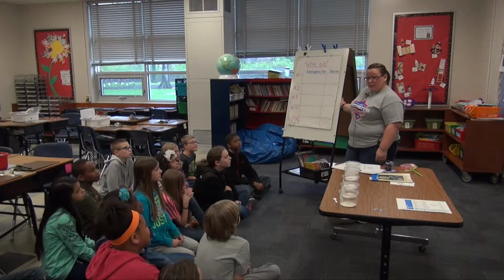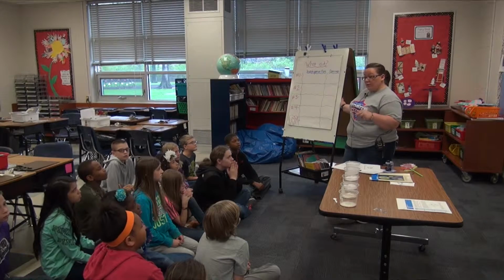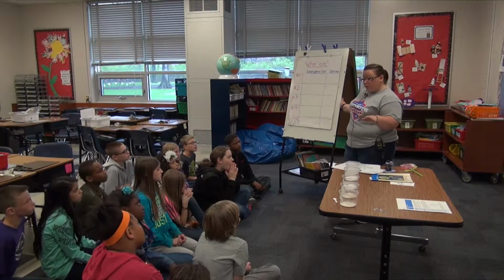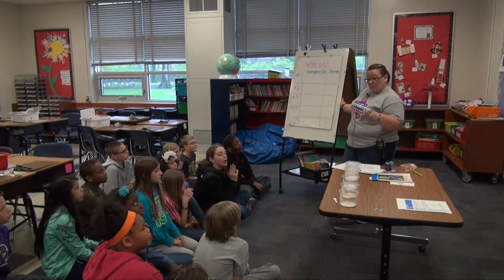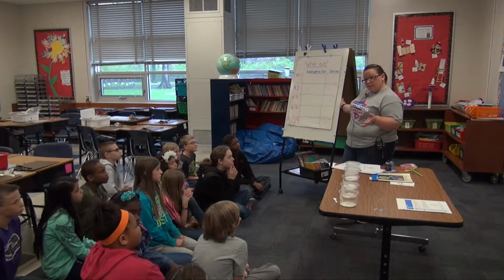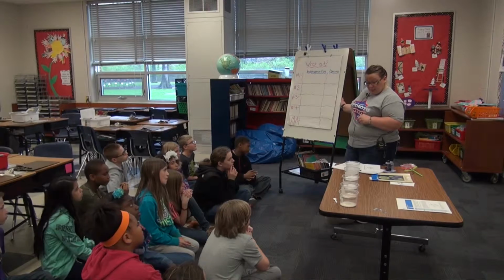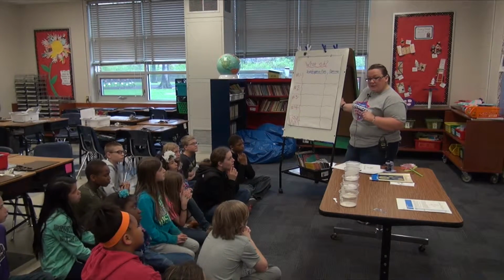Boys and girls, this morning we're going to finish our lesson on specimens and well slides. You're going to be completing a challenge called What Is It? You have 4 different specimens and 1 mystery mixture that you're going to have to determine what it is. Your objective for today's lesson is to identify unknown specimens and substances using identifying clues.